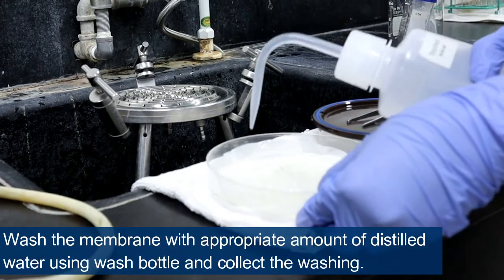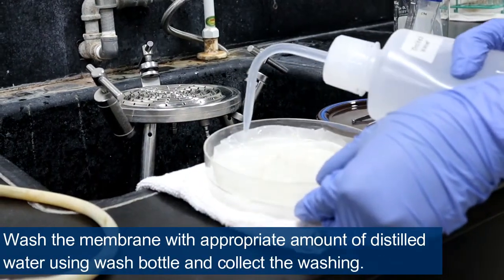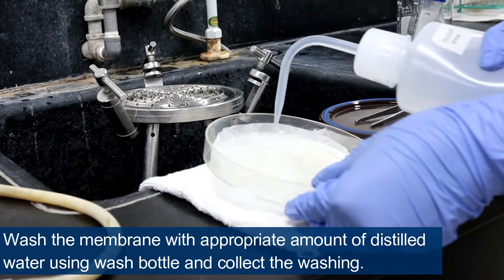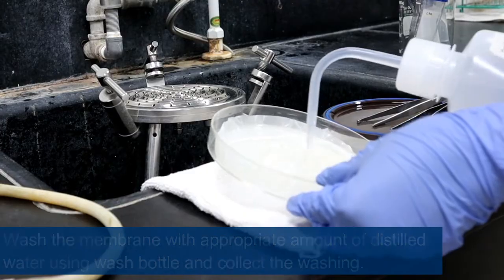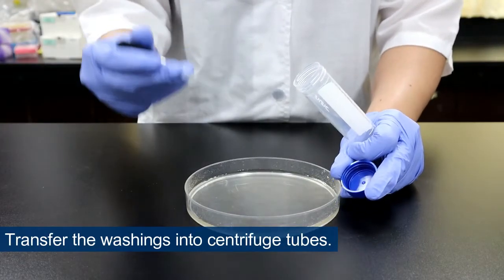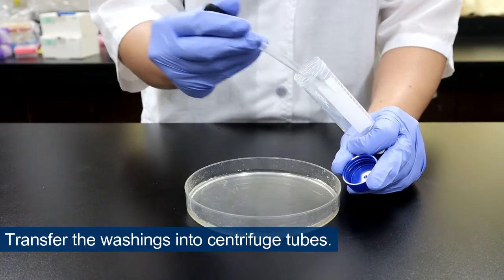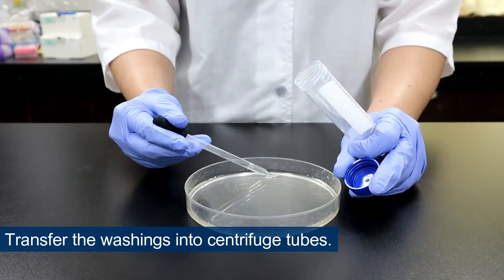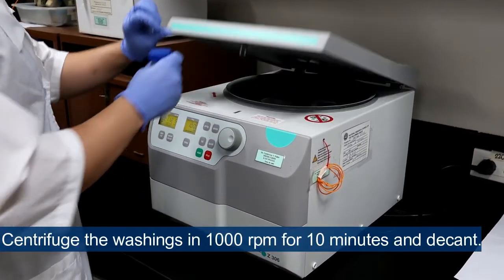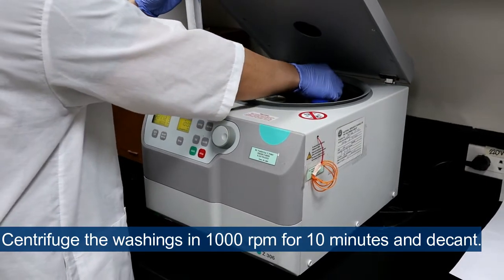Wash the membrane with an appropriate amount of distilled water using a wash bottle and collect the washings. Transfer the washings into centrifuge tubes. Centrifuge the washings at 1000 RPM for 10 minutes and decant.